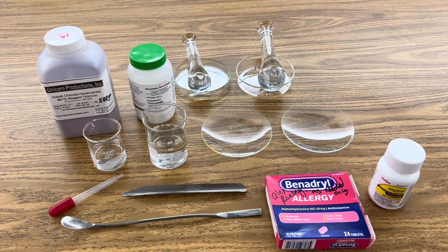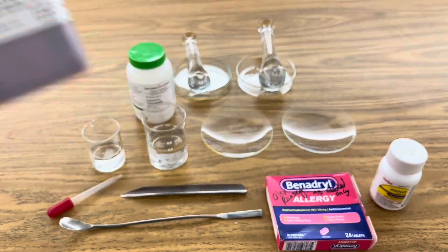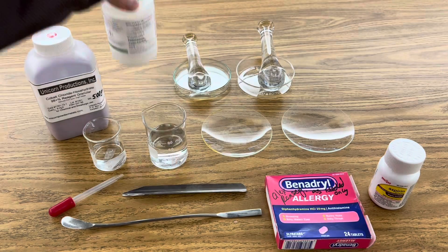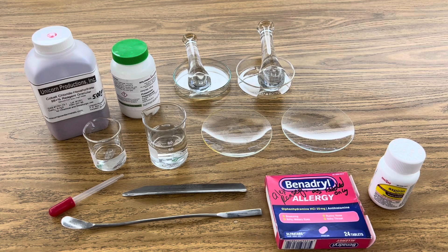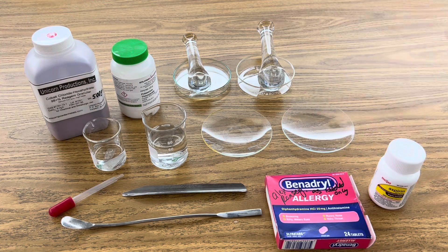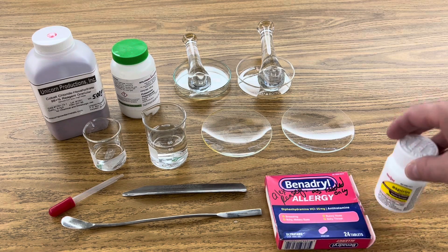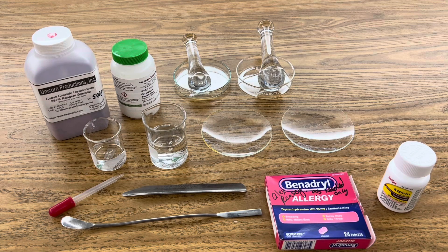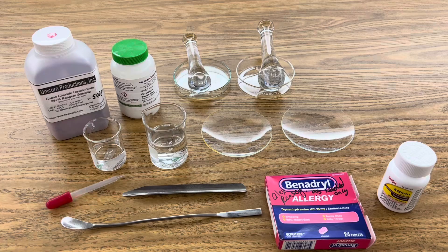So all I'm using in this investigation is cobalt chloride, a little bit of potassium thiocyanate, one beaker with 60 mils of distilled water, the other with 20 mils of distilled water, a couple of pestles, some petri dishes, a couple of watch glasses to test Benadryl and aspirin. Benadryl gives a false positive for the Scott test, and my measuring spoon and a dropper — and that's all there is to it.